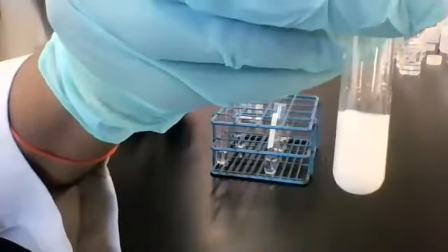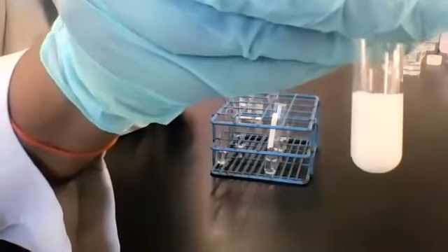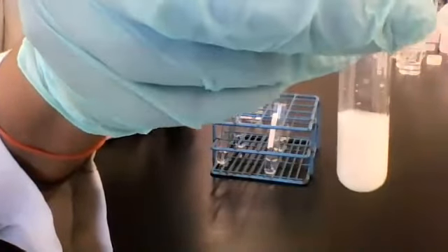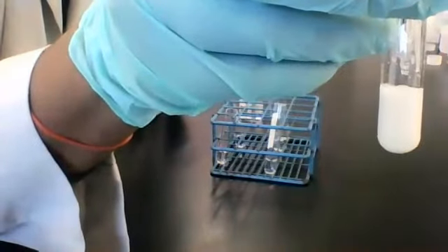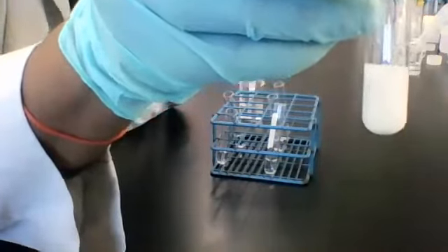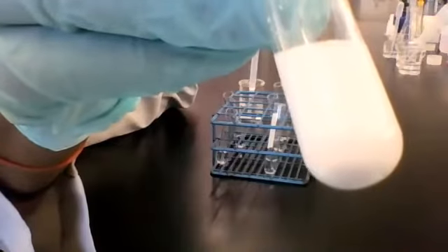This is solution 1, which is NaCl, reacting with reagent C, which is either, what are the three again? AgNO3, NaOH, or HCl. It's one of those. Look closely at the bottom of the tube here. I hope you can see what's there. Which solution is this again? This is solution 1, okay, reacting with reagent C. Oh, okay. Okay. All right.